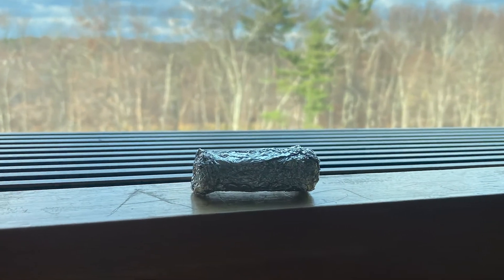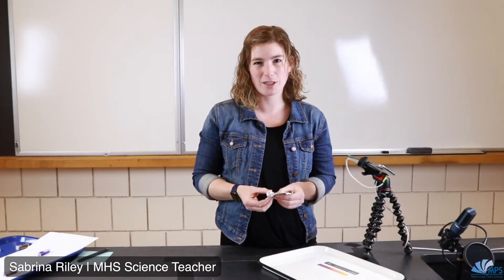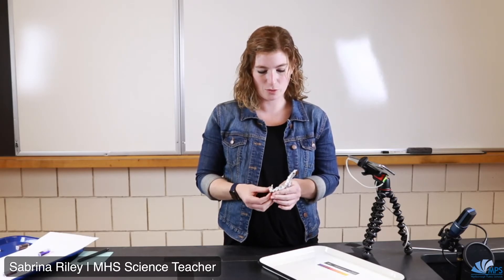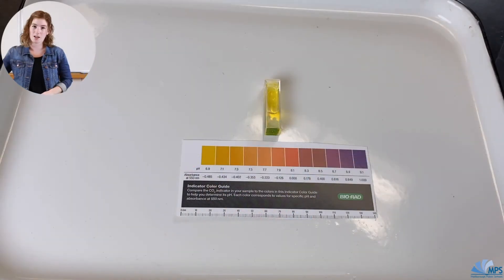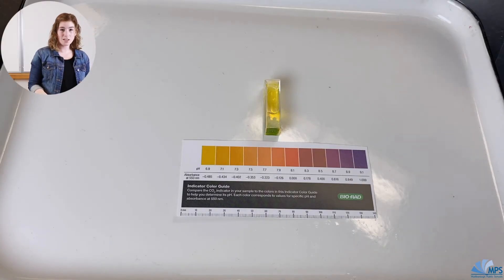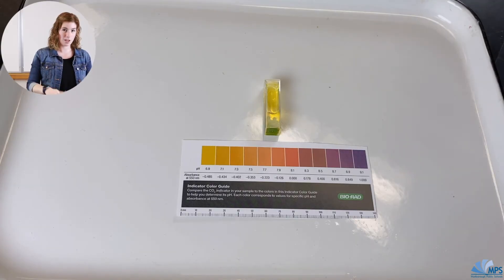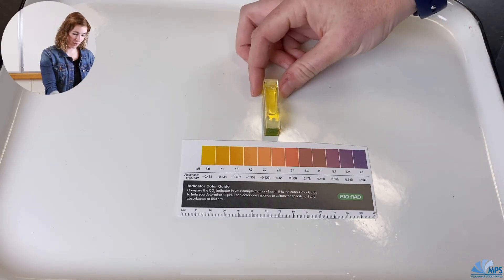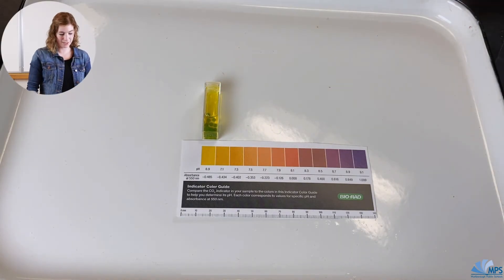My final condition is the one wrapped in tin foil. Think about what process should be taking over here — I'm not providing it with lots of light, but plants do cell respiration as well as photosynthesis. When I unwrap this one, I notice the CO2 indicator is very yellow. Compared to the plain indicator, this is even more yellow, meaning the pH is even lower than it started. This matches the bottom of my pH scale at 6.9.